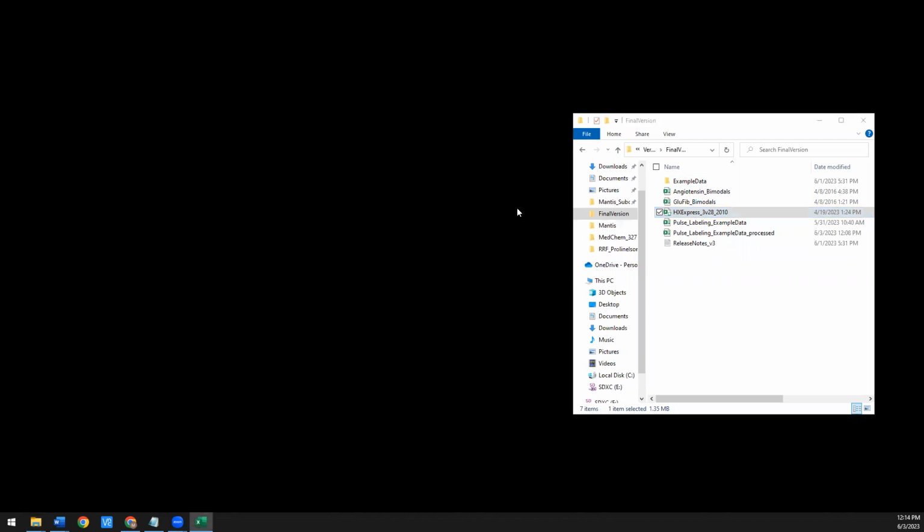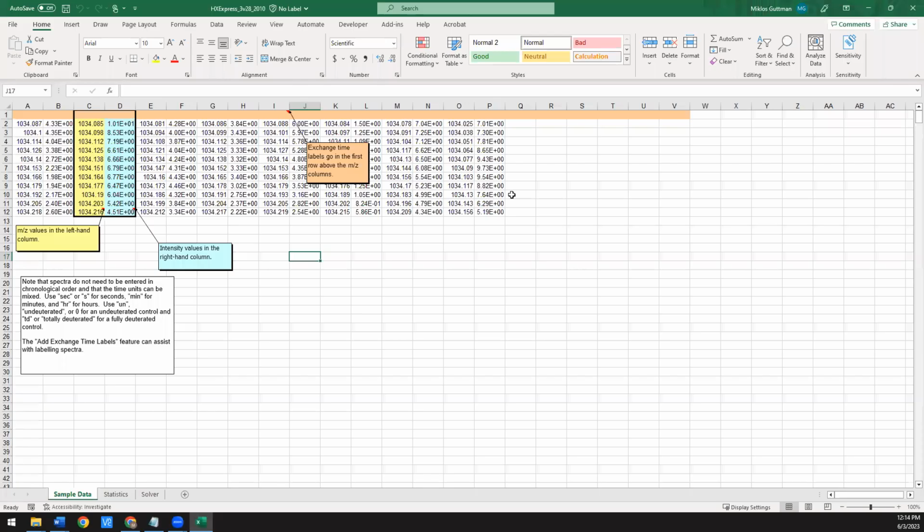And today I'm going to be working with Microsoft Office 365. It also works on Office 2016. I don't know if it'll work on versions previous to that, and I've never tested it on the Macintosh version of Office, so I can't guarantee any of that functionality. So when you first open it, you might see a splash screen. Just say OK. You might have to say enable macros.